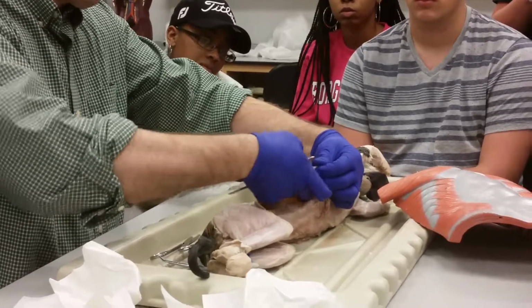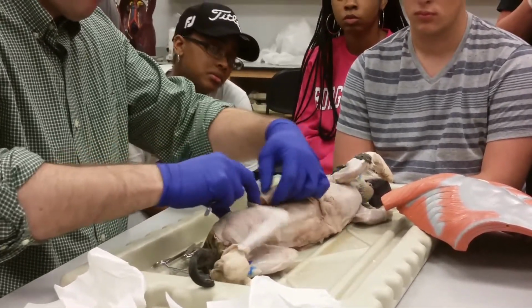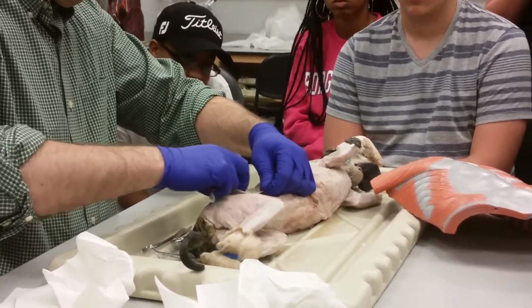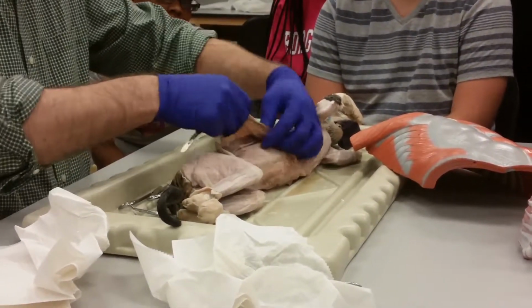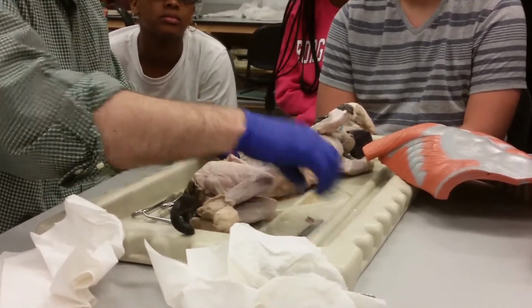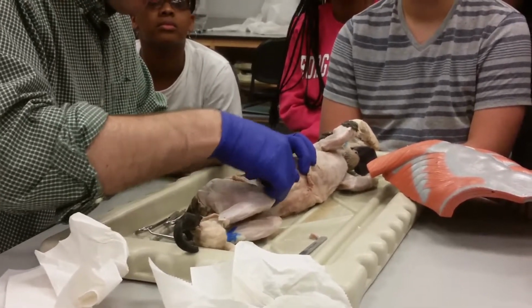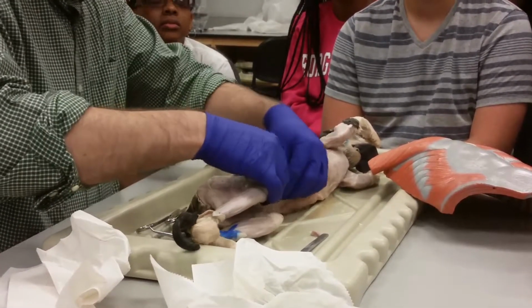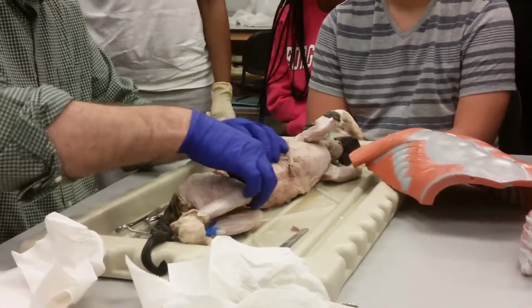Okay, so there's that external oblique. Separate it well from there. Let me cut it here. Okay, so now we can fold it back. Look underneath. There's a little bit of deep fascia. There's the edge of the aponeurosis of the external oblique where I cut it. The other side of that cut.